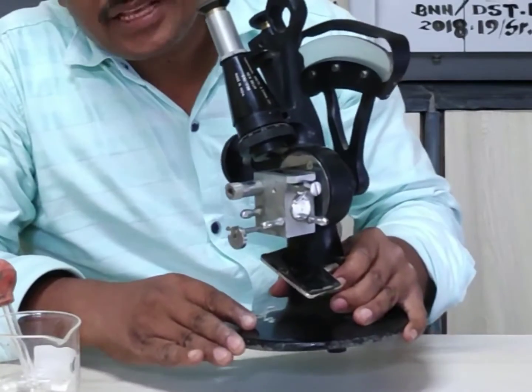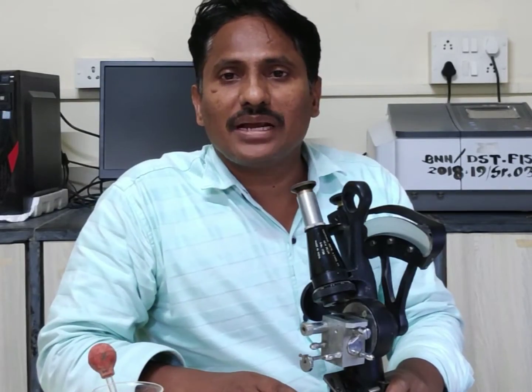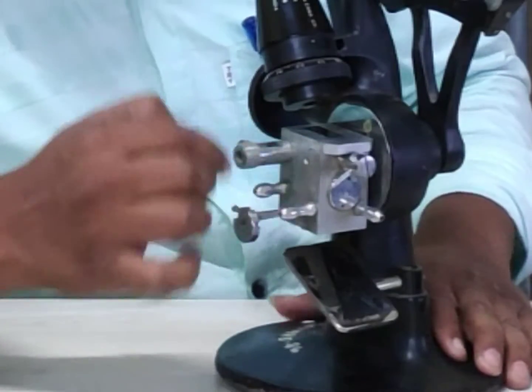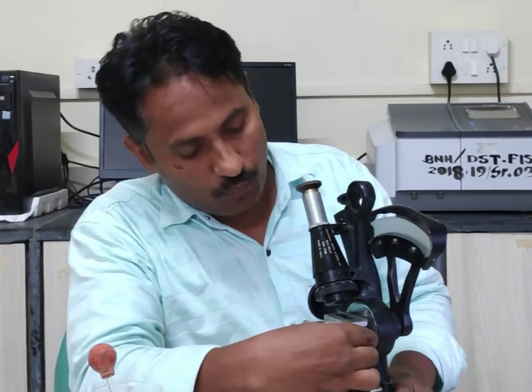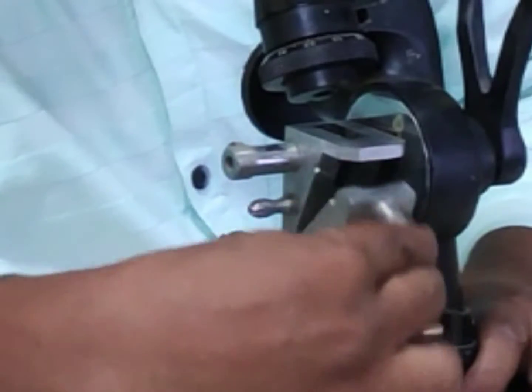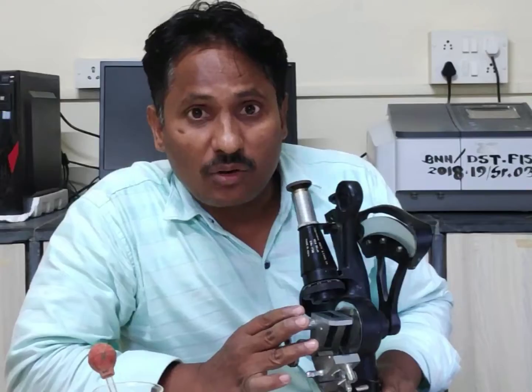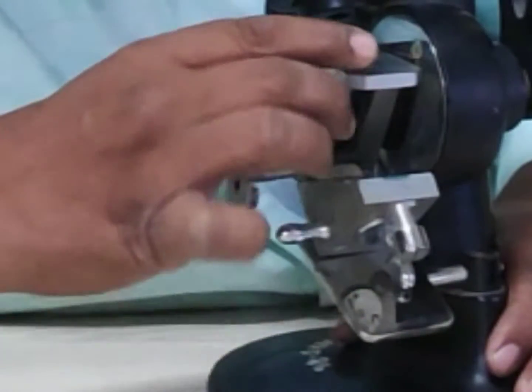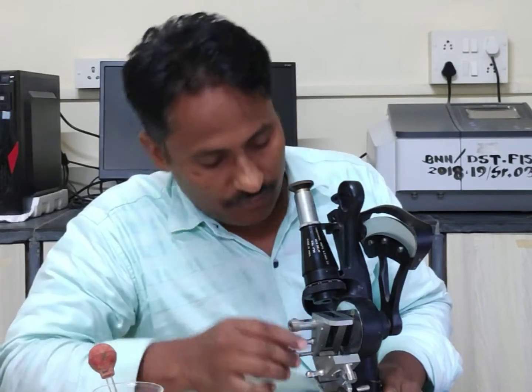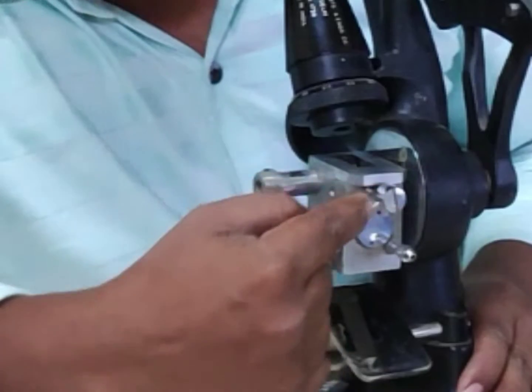This is the Abbe Refractometer, used to determine the refractive index of a solution. This is the prism box, which is an important part of the instrument. There are two prisms here, and we can lock them with the help of this knob.